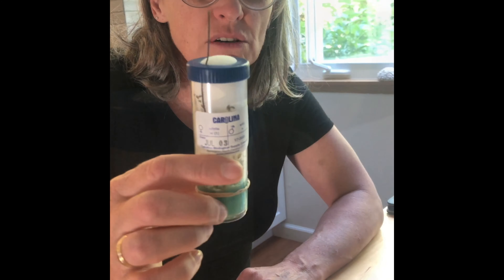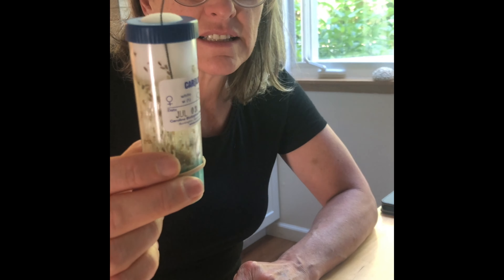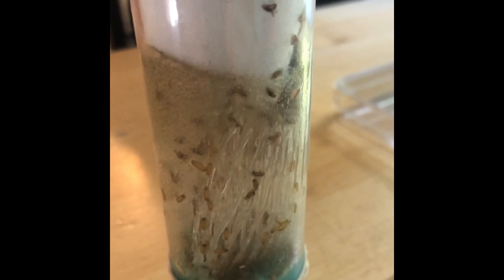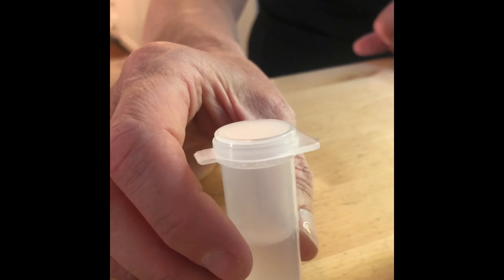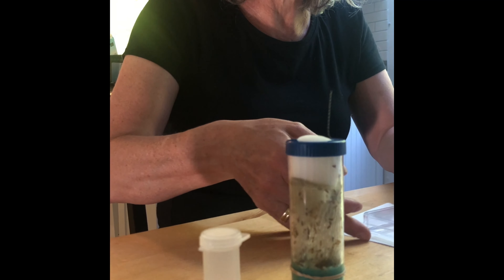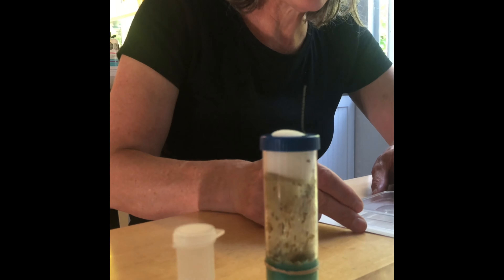The flies are slowing down. I asked Alexa to set a timer for four minutes because they need to sit for four minutes. I've also generated a morgue for the flies — it contains ethanol, and when they're dead I'll sacrifice them and put them in there. We need to count every day because more will emerge, but it looks like I have plenty of flies.